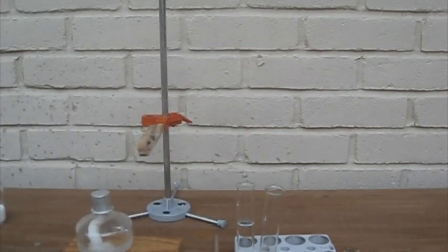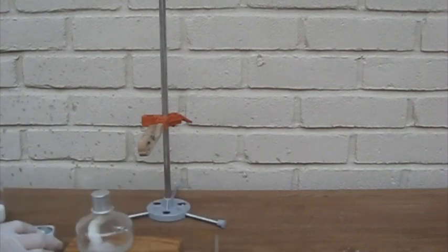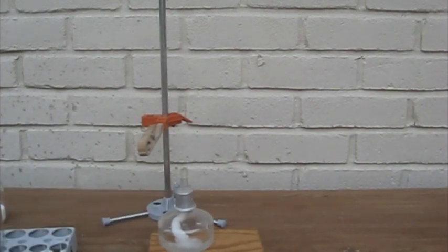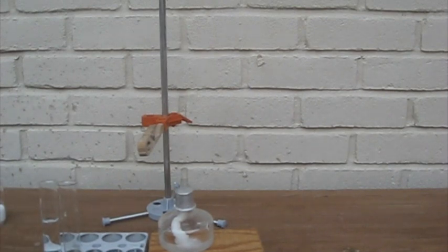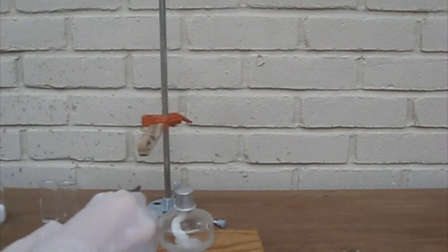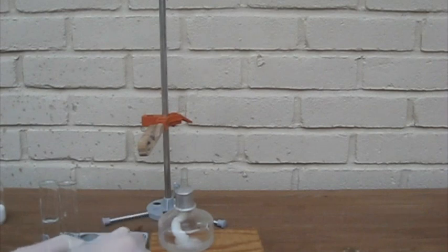Here's the sodium hydrogen sulfate. And I'm adding around an equal amount to the sodium chloride, which is the salt. That's the chemical term for table salt.